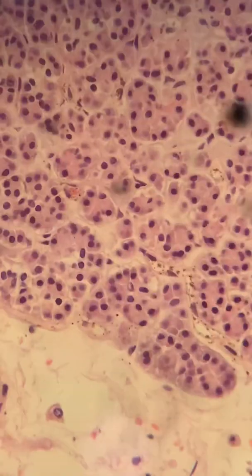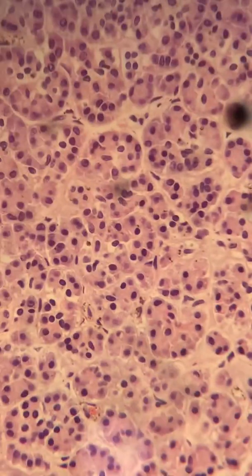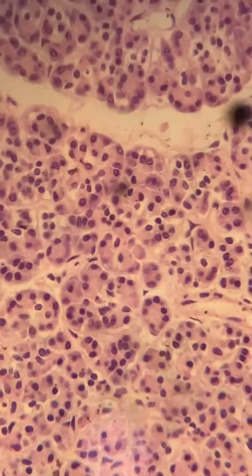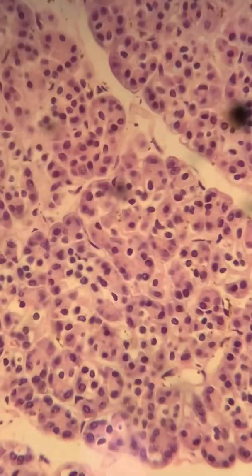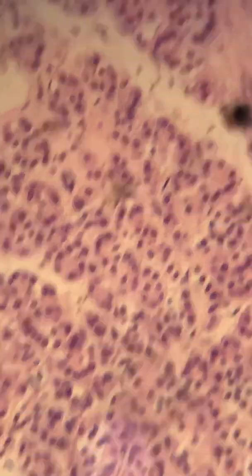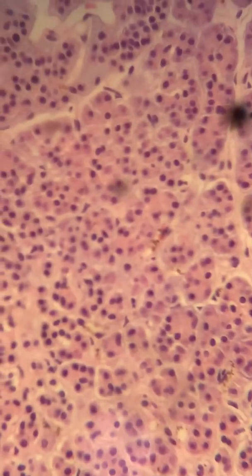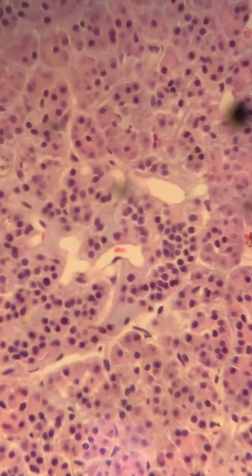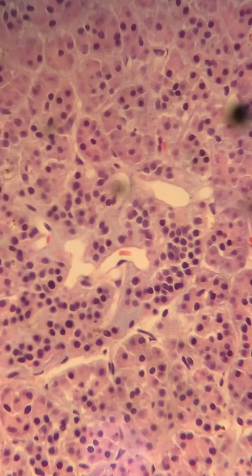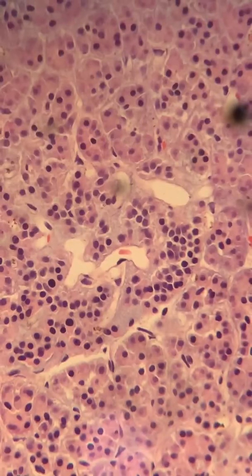What we want to look for is islet cells. There's not much in the way of islet cells visible yet, but we're going to find some. I can assure you we're going to find some islet cells, because in my opinion this pancreas was functional. Okay, there — we're getting some islet cells there.